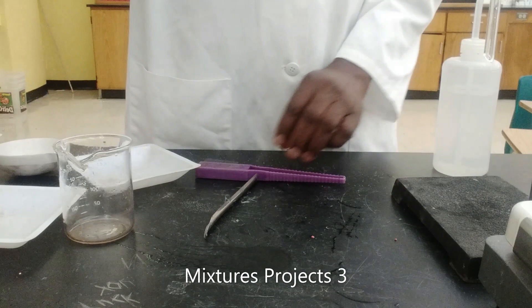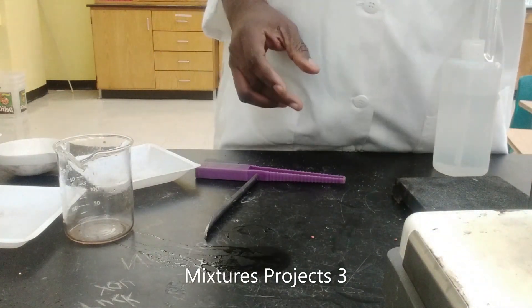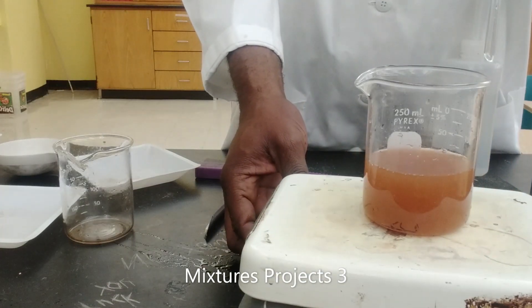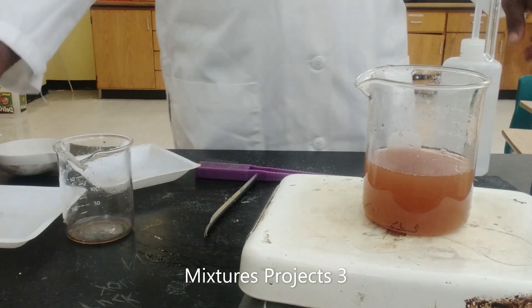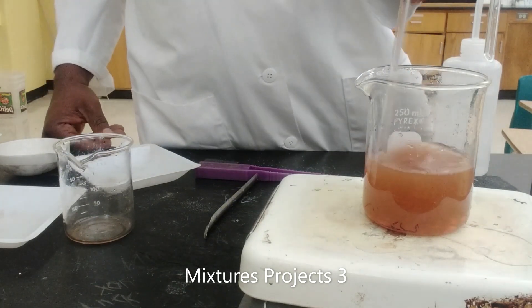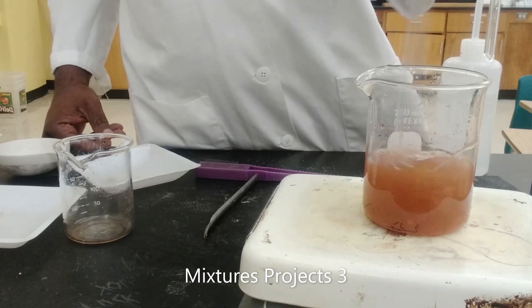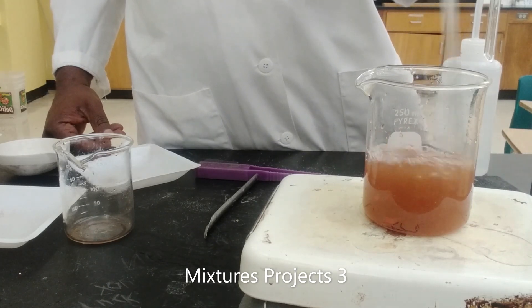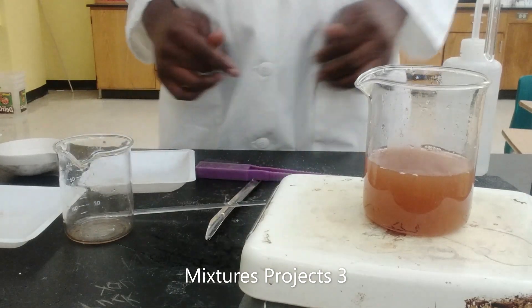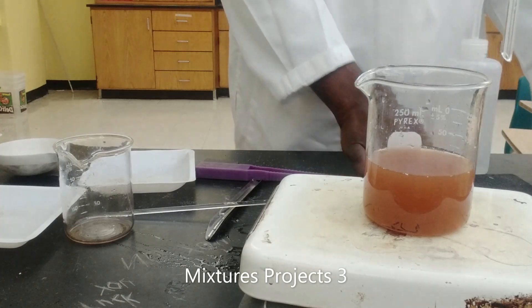So right here we have a mixture of our chalk and salt. Remember the salt can dissolve readily in water. I want the salt to dissolve much more faster, so I'm going to warm that mixture there.